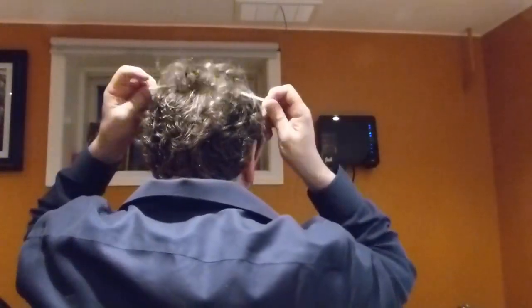There are two straps — you can tell these straps are actually plastic, but much better than the other one. Separate the two straps, chin in first, straps over the head — bottom strap at the back, top strap over the crown. No strap is to touch your ear. Once the mask is on, mold it aggressively to your face — aggressive on the nose first, then hold it tight and make sure it's pulled down. This one actually has plastic at the bottom too.